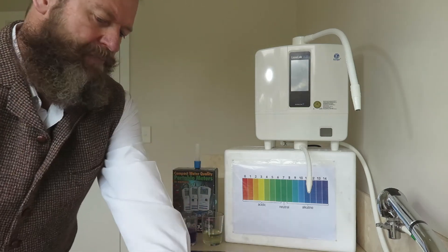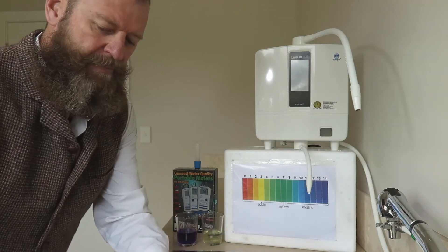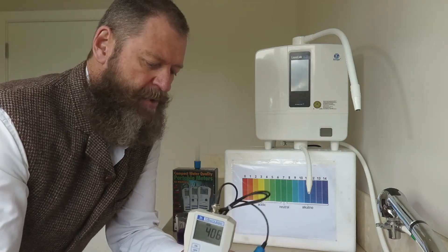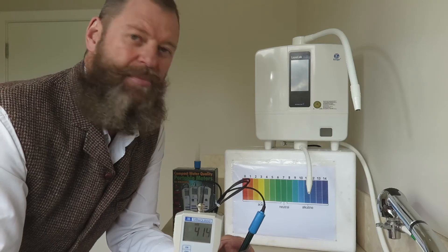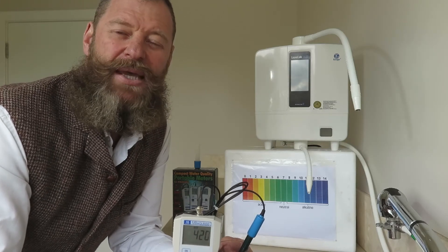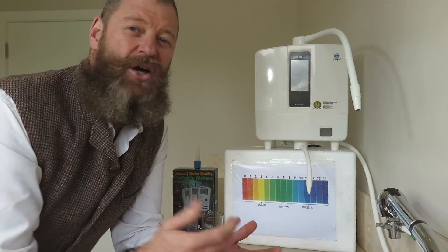I take it out, grab whatever I'm going to be testing, put that in, and that's going to be my reading. So whenever you calibrate your machine for presentations, make sure you take the time to calibrate it properly, or else your negative readings are going to be incorrect. Your positive readings — for example, reverse osmosis bottles of water — don't need the machine calibrated for that, because anything positive is already been accounted for.